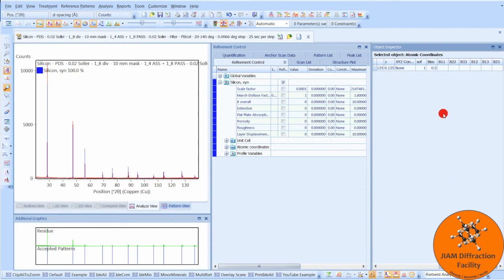Scroll over. Here we have SOF, and this is the site occupancy factor, and it indicates what fraction of a site is occupied by a specific atom. If the value is 1, it means that each atomic coordinate shown here is occupied by the atom we specified for this row, which is silicon for this example.